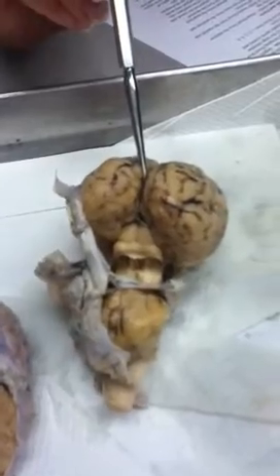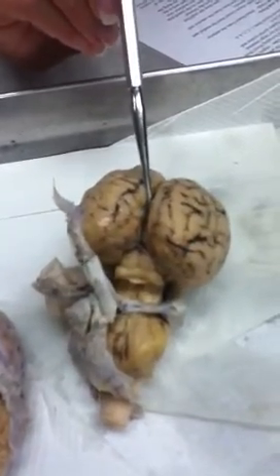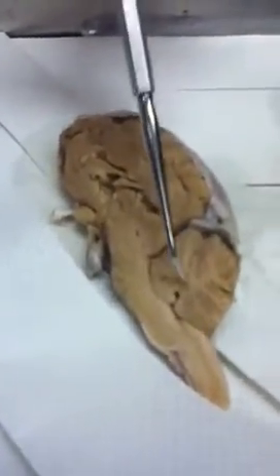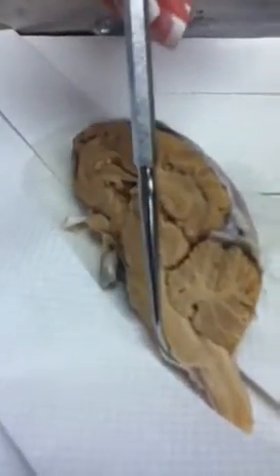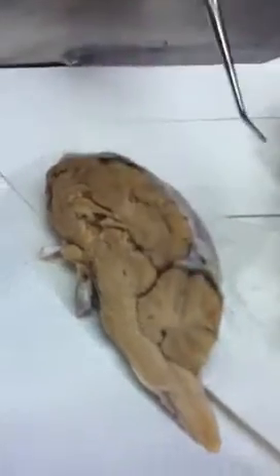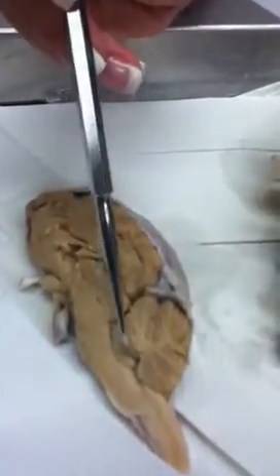On the top, you have the pineal body. Then the first two pairs of bumps, the ones that look like a butt, that's the superior colliculi, and beneath that is the inferior colliculi, okay? Collectively making your corpora quadrigemina. Back over here, in the cerebellum, you could see the arbor vitae, and then again you could see your areas here, the pons, the medulla oblongata, and the spinal cord, okay? And in the bottom of the cerebellum, your fourth ventricle. Okay? Thank you.